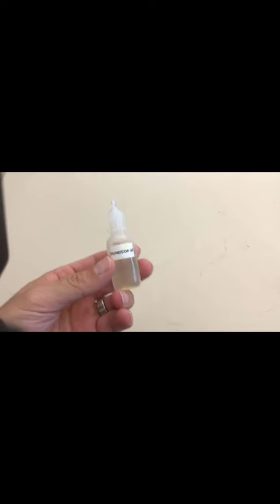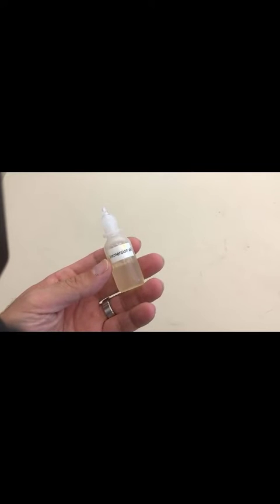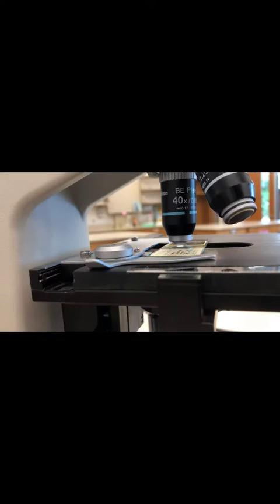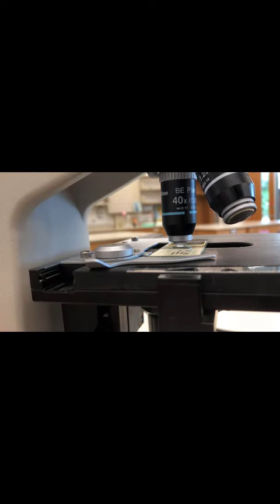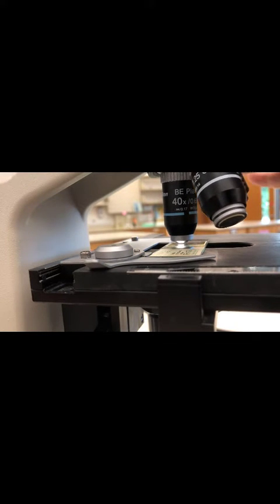To get to oil, you're going to need this lens, this immersion oil. It has the same refractive index as glass. So you're going to lower reflection and refraction of light.